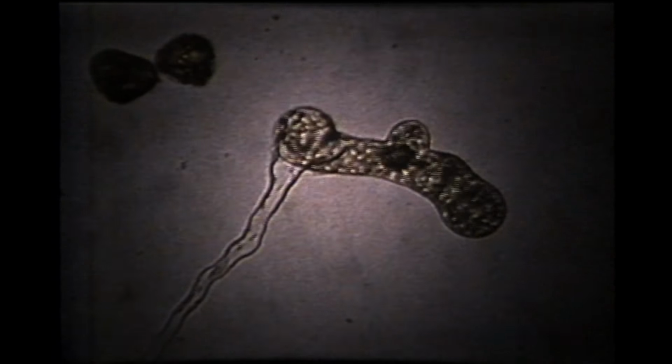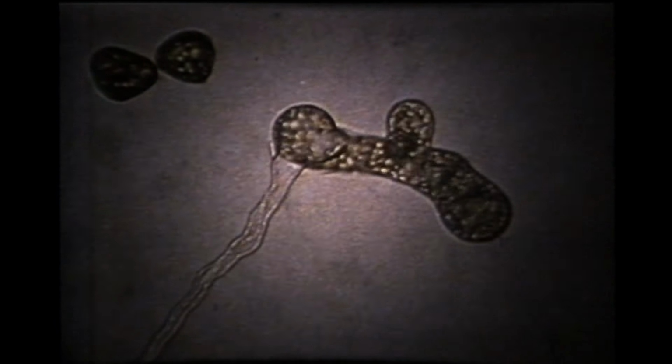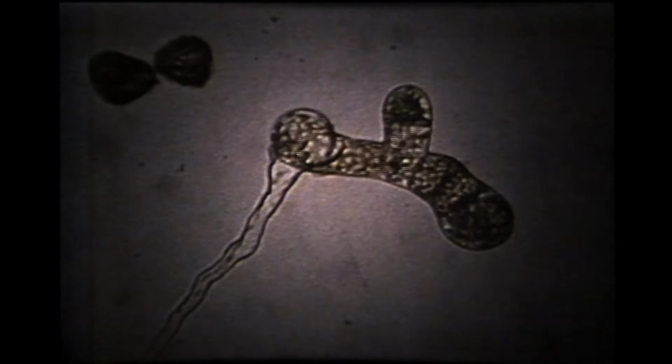In addition to triggering germination, antheridogen induces the formation of antheridia on the filaments. Within the antheridium is a central zone where numerous nuclei form, each becoming the nucleus of a single sperm. The antheridium itself consists of a basal cell, a ring-shaped cell, and a cap cell, seen here with their nuclei cleared in chloral hydrate solution. At the center, 2 spermatogenic nuclei have formed. Here, the 8-nucleate stage has developed.